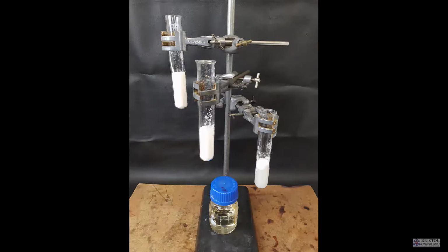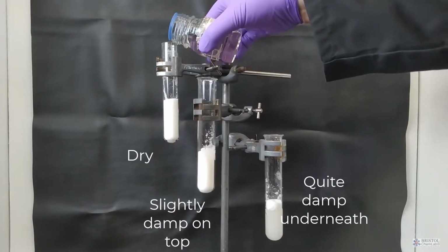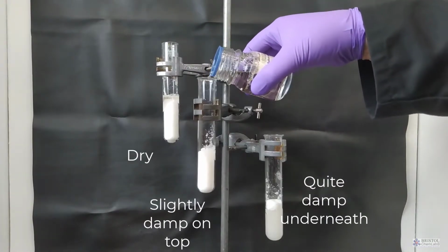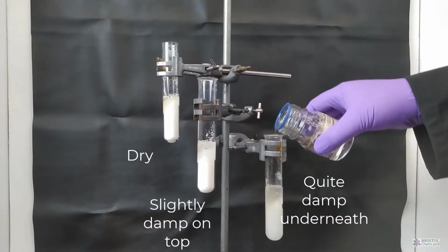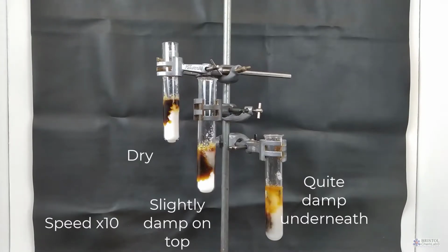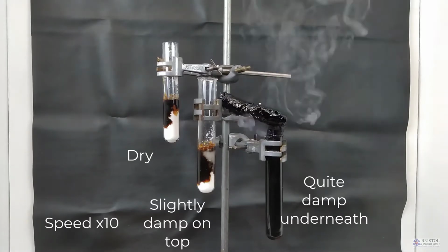And even using dampened sugar, I would demonstrate this with two or three tubes clamped, because the time in which they go off seems to be very variable. You need to be aware that sulfur dioxide is produced in this reaction, so don't have your asthmatic sat near the front. In fact, your local regulations may require you to do this in a fume cupboard. Doing it in a beaker is also possible, but your technicians won't love you for this.